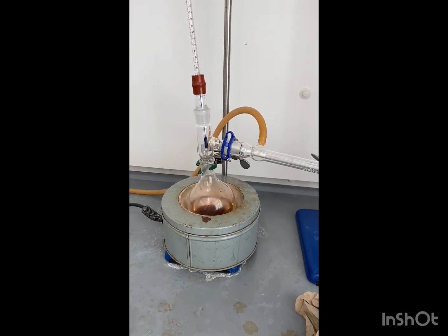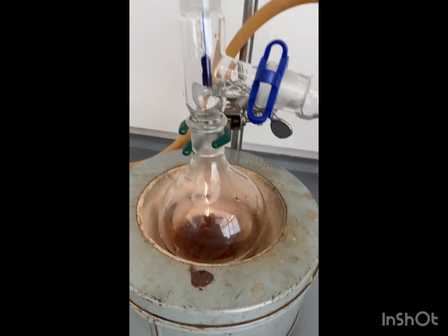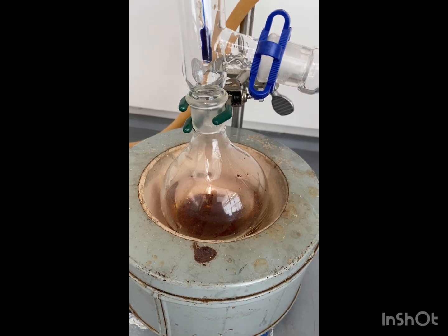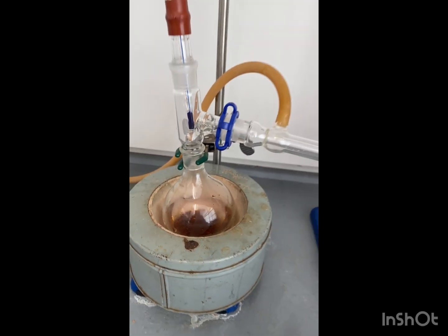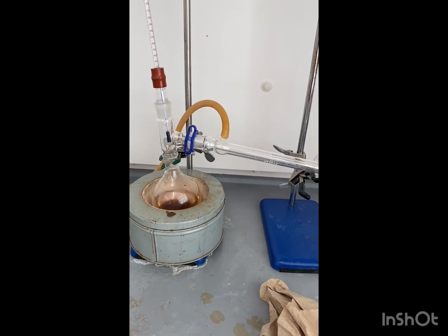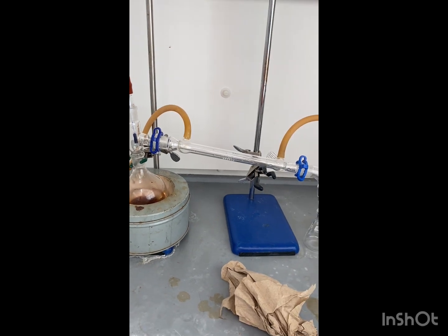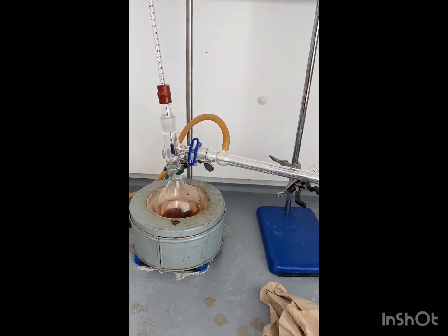So I've added 75 ml of water to our round bottom flask with our cinnamon. We have our distillation apparatus set up. We're going to start distilling.